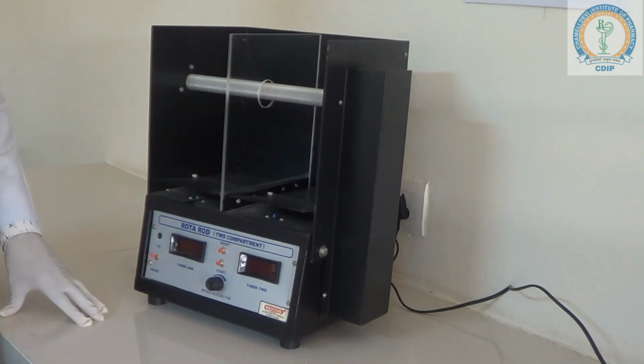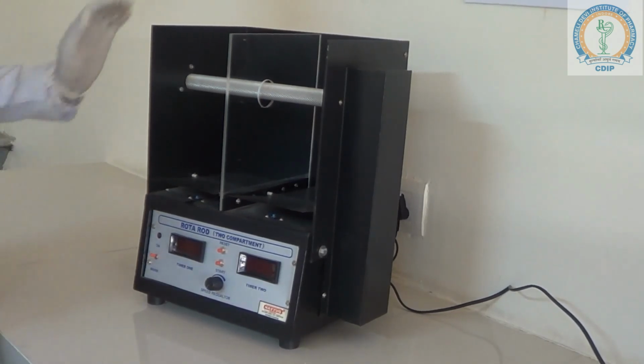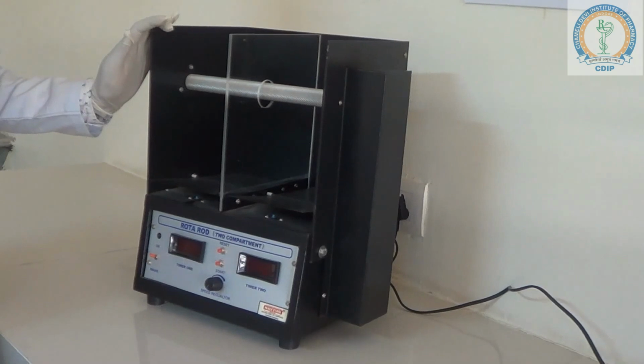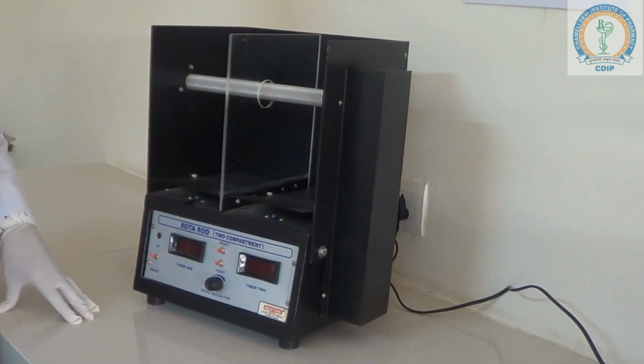In this video, we are learning about Rotarod apparatus. Rotarod is an instrument. It is widely and most commonly used to assess drug effect on motor coordination, balance and motor learning in rodents. This Rotarod apparatus is used to study skeletal muscle relaxant. In addition, it is used to measure parameters such as riding time, evaluating balance, grip strength and motor coordination in experimental animal.